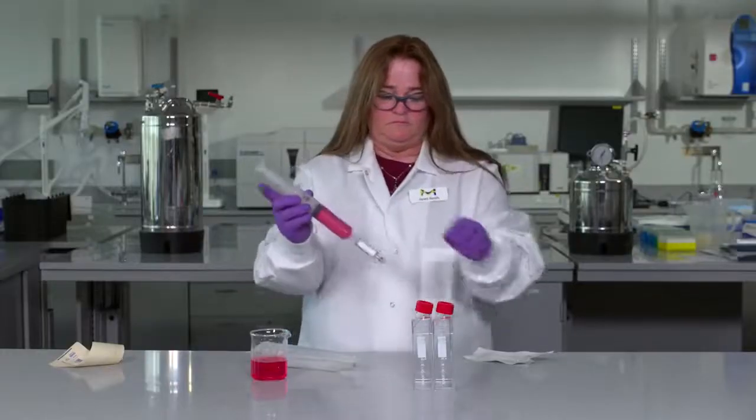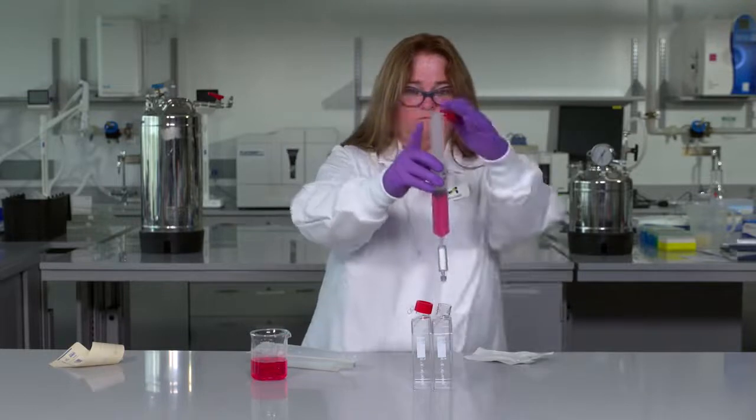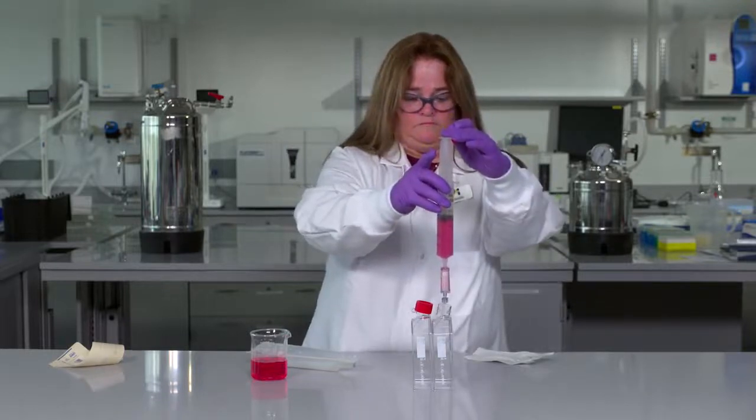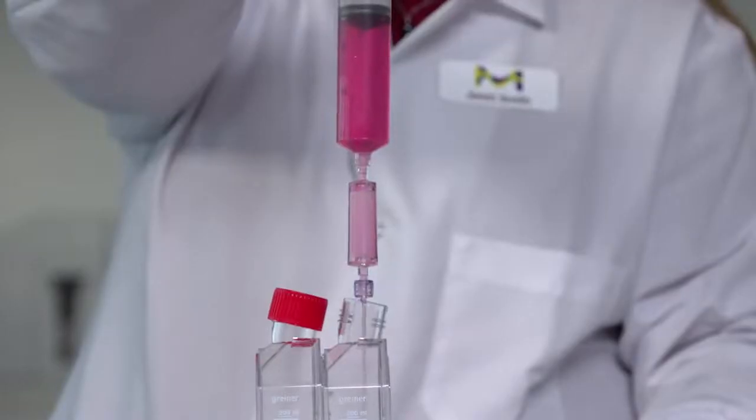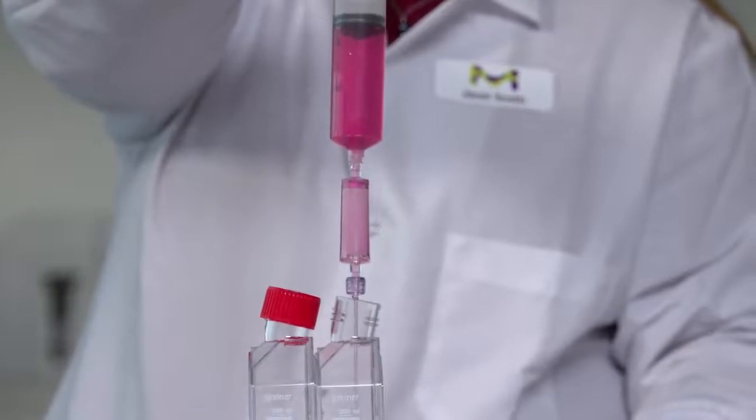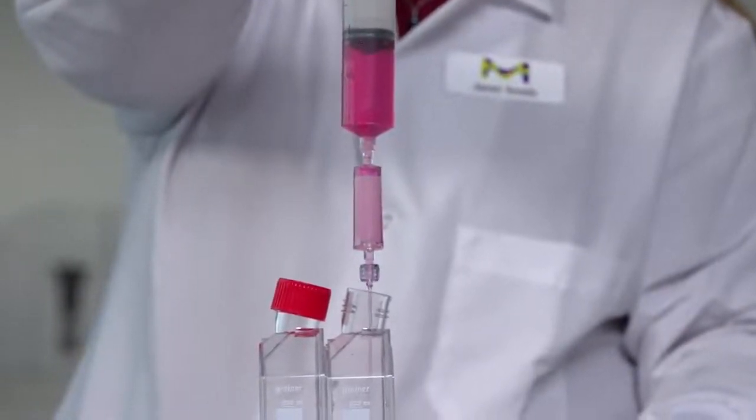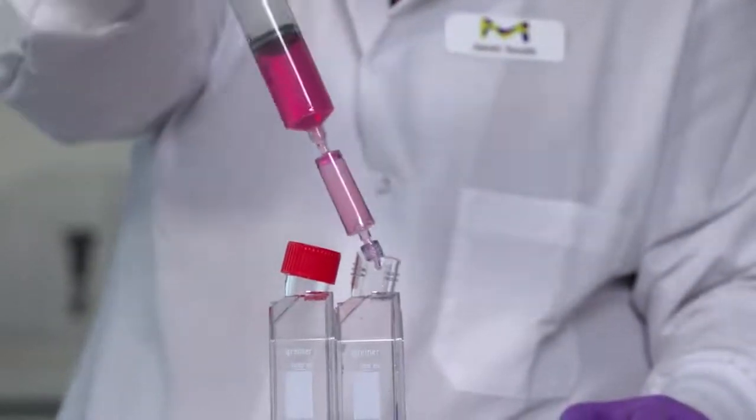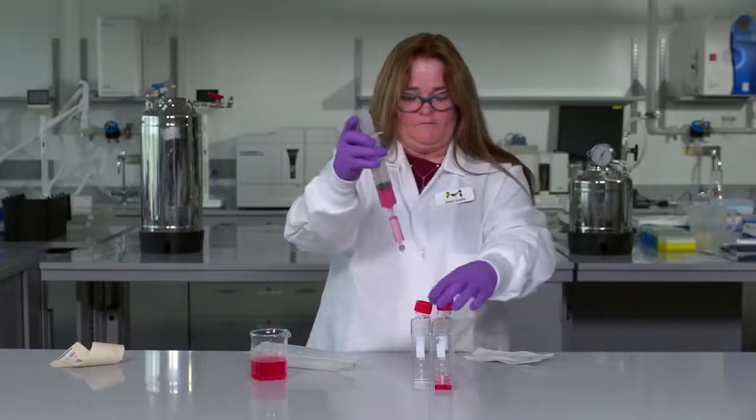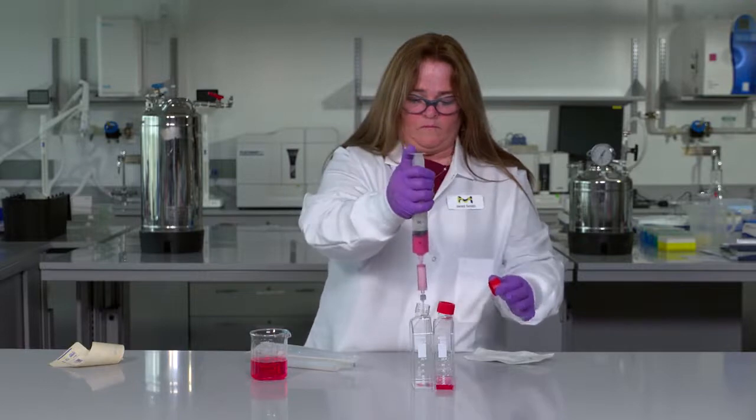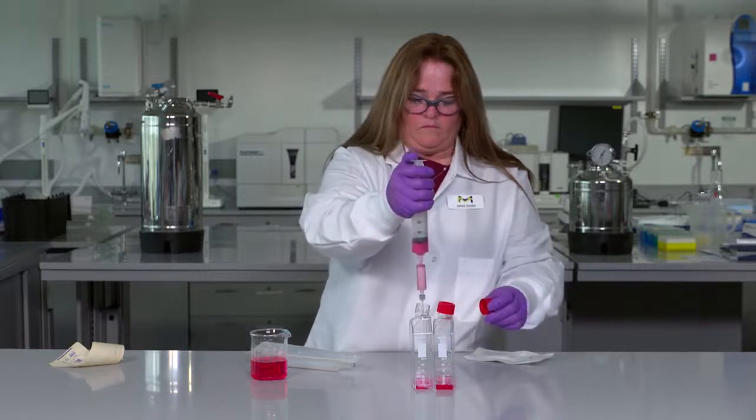Push syringe plunger and deliver filtered solution into an application appropriate container. Disconnect syringe to refill and reattach to process larger syringe volumes to device capacity. Once complete, detach by rotating inlet connection counterclockwise and discard filter and syringe appropriately.